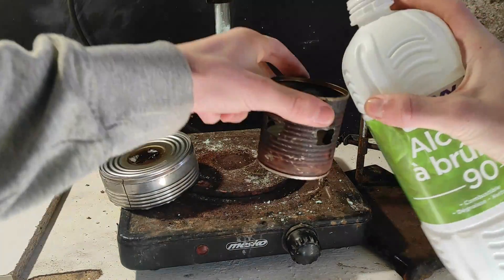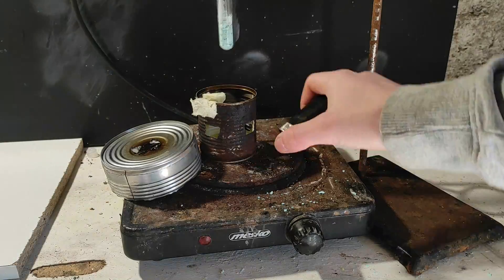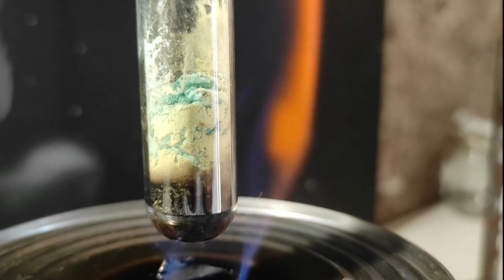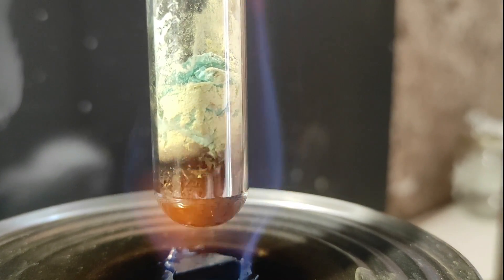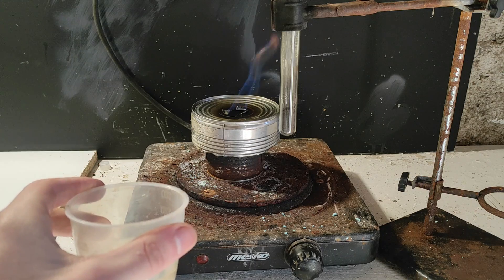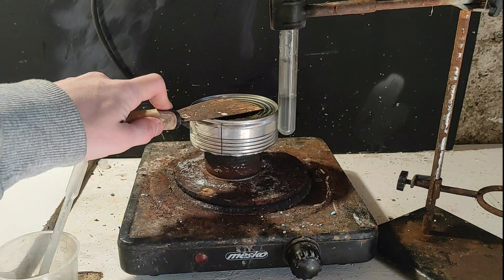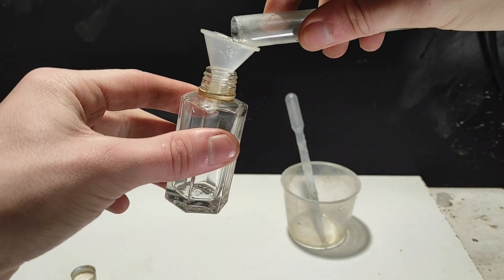We will now decompose our nickel oxalate into carbon dioxide and pyrophoric nickel. I made a small burner filled with alcohol. The decomposition is most efficient at around 200°C, but here I used the random temperature from the flame, which I measured to be around 400°C. The decomposition is beautiful: the blue solid first goes through a yellowish transition state while emitting wisps of carbon dioxide, then becomes a final dark grey powder. When the decomposition was complete, I directly added water to the solid — otherwise it would have time to oxidize in air, since the CO₂ emissions during the reaction were temporarily preventing oxidation. I labeled the new container and put the sludge inside — it should be usable as a catalyst for hydrogenation reactions.